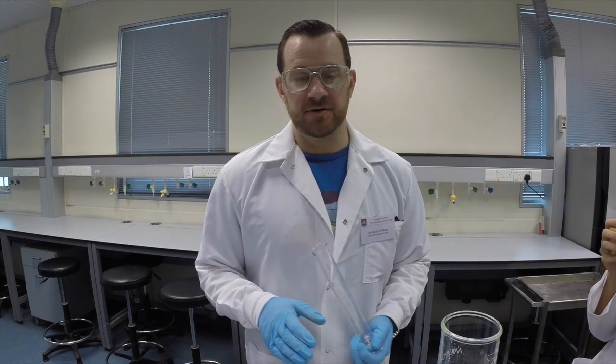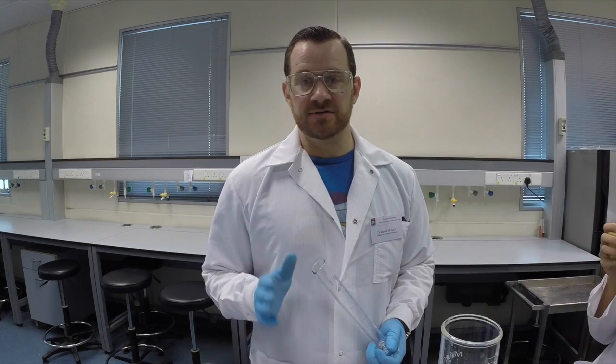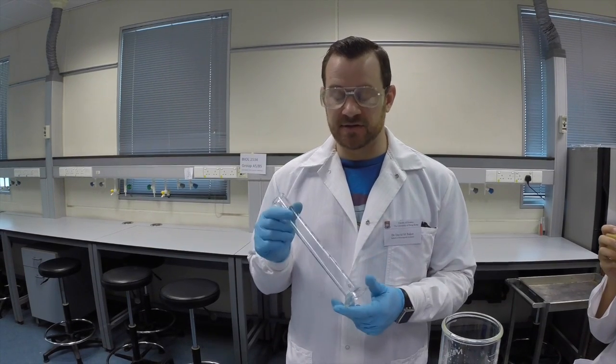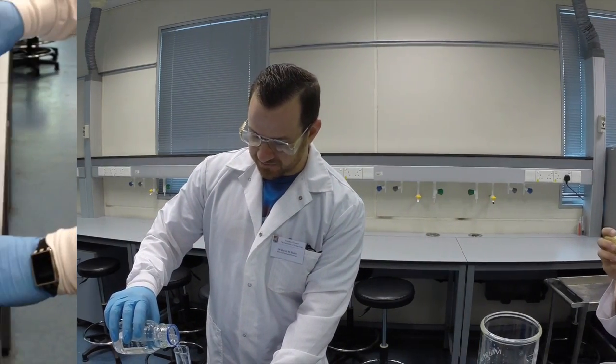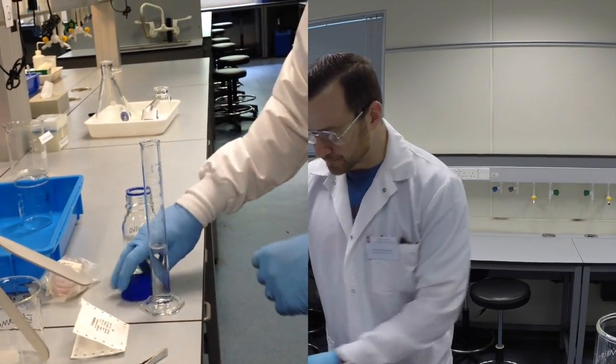So in this lab, you are going to take one sample from Victoria Harbor, which is assigned to you on the last sheet of the protocol, and you're going to be filtering 1, 5, and 100 milliliters of that solution, and you'll use the graduated cylinder to measure that. So for demonstration purposes, I'll just fill up a certain volume of deionized water as my control.